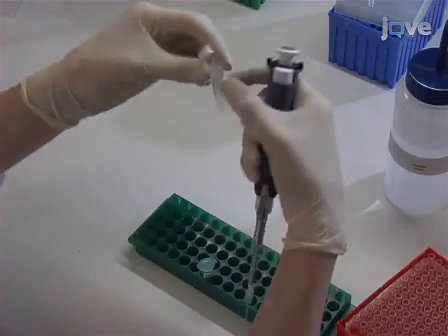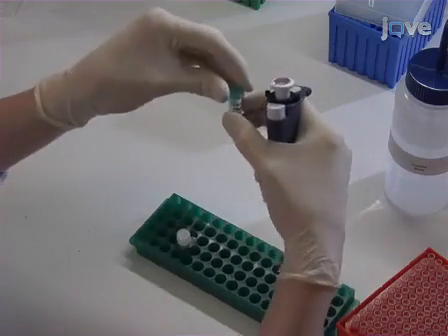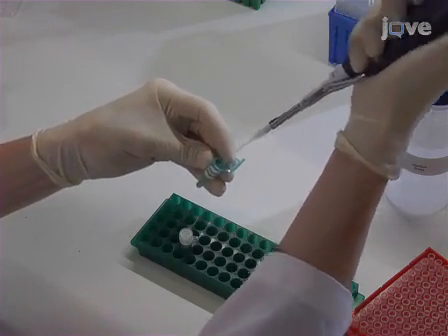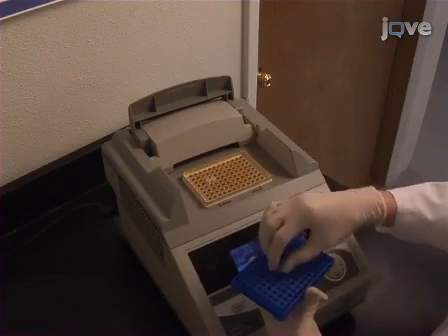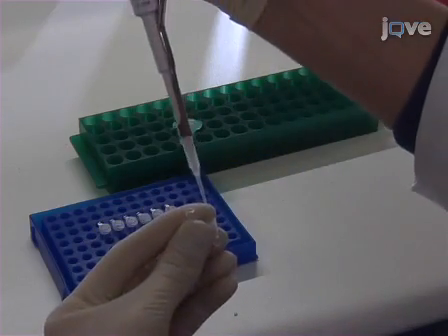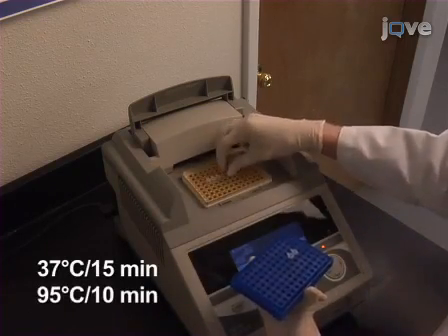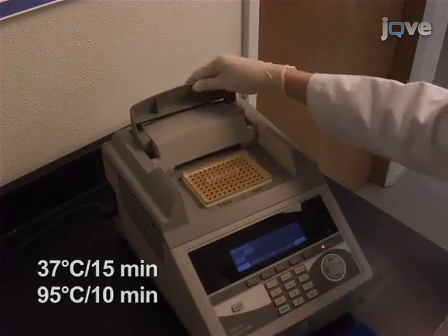Prepare the enzymatic digestion mix by combining 2.2 microliters of the enzyme reaction buffer, 0.8 microliters of nuclease-free water, and 1.0 microliters of lambda exonuclease enzyme per PCR reaction. Remove the samples from the thermal cycler and add 4 microliters to each PCR tube. Return the samples to the thermal cycler and program it to 37 degrees Celsius for 15 minutes, followed by 95 degrees Celsius for 10 minutes.